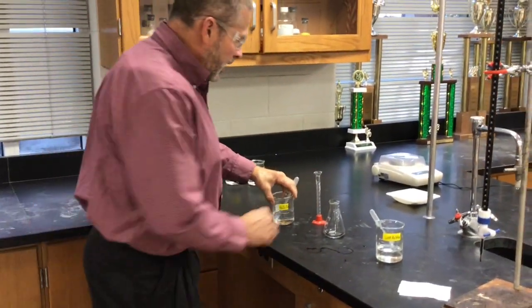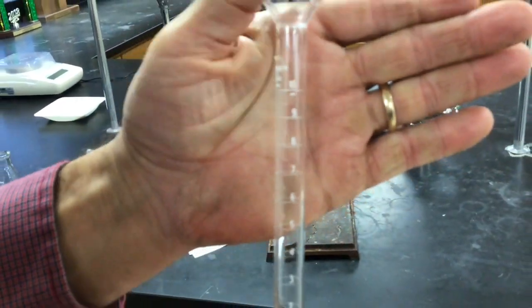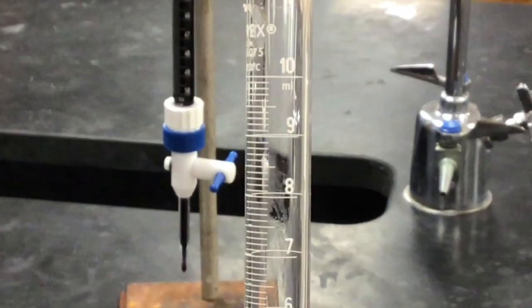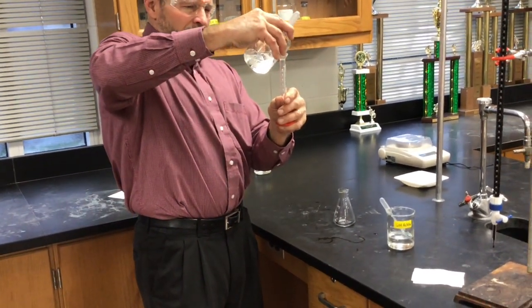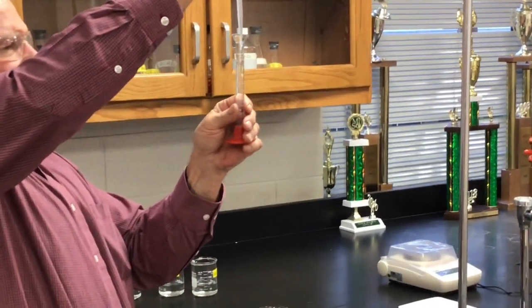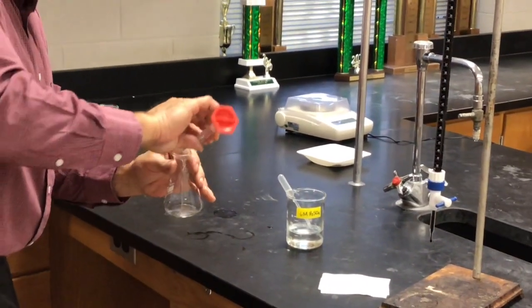Okay, so we're going to have to measure out some of the peroxide solution. Here's the cylinder that I'm using. You can see the graduations. This cylinder is graduated in 1/10 milliliter increments. You can see the graduations on it are to the 10th. So when you measure out 10, we can call it 10.00. There's a dropper here so we can try to get as exactly close as we can to 10.00. Put that in our reaction flask.